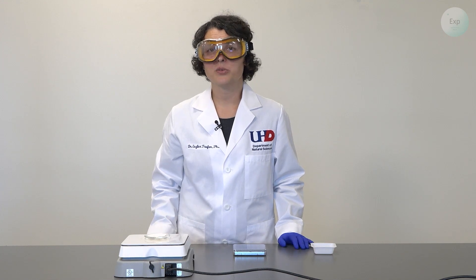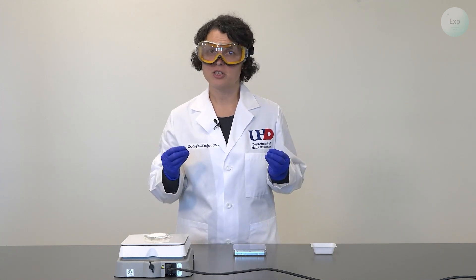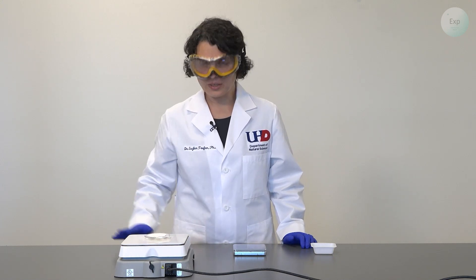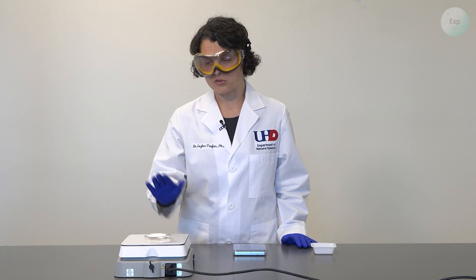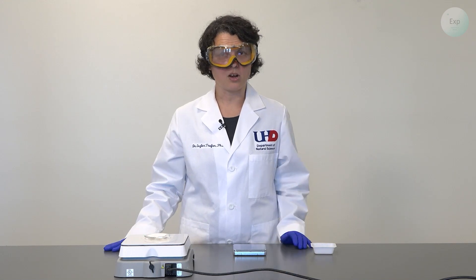It has been approximately 20 minutes, and it appears that our filter paper with the recovered calcium hydroxide on top is completely dry. I can tell because the paper seems a lot more rigid, which is due to the dehydration. At this point, we completely turn off the hot plate and carefully wait a couple of minutes before the watch glass is cool enough to touch. Should we be in a rush, it is important that we treat hot glass with adequate care and use tongs to extract it from the hot plate, placing it on a wire gauze to avoid any kind of breakage in the process.